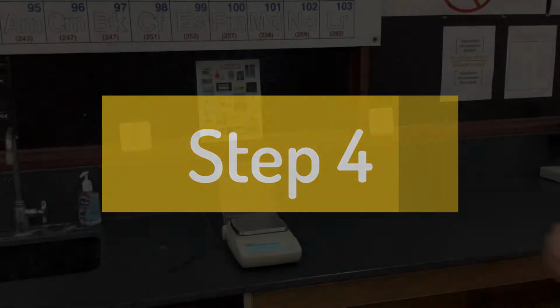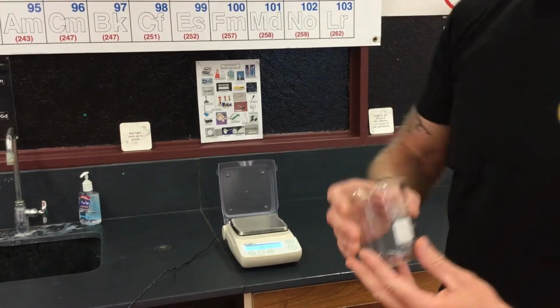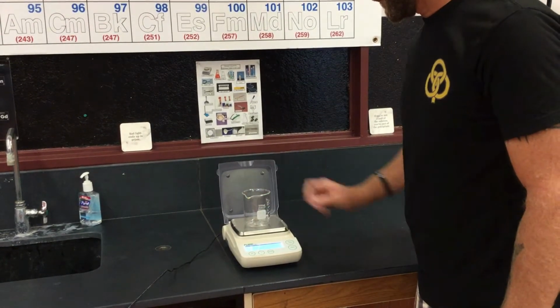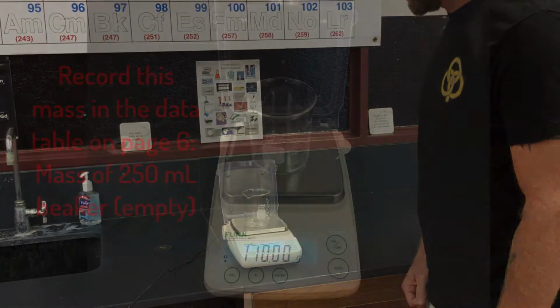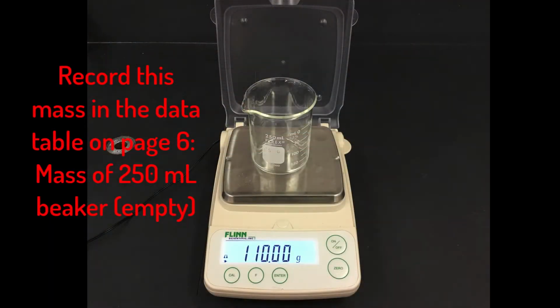Get a 250 milliliter beaker, label the white spot with your initials and your lab period, and then mass the 250 milliliter beaker on the balance that reads to the 100ths place. Record this mass in the data table on the top of page 6.